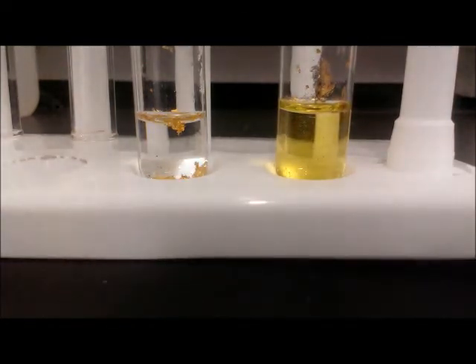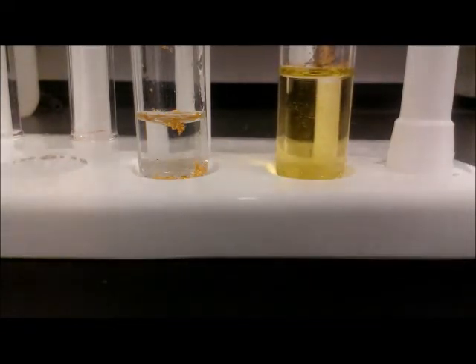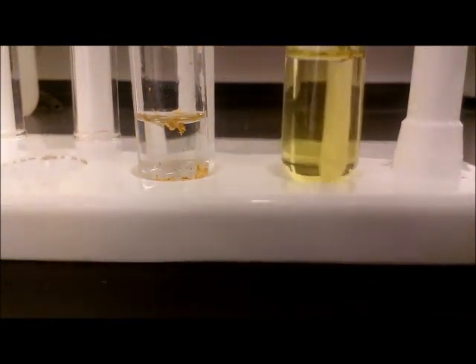You will see that after just a few seconds, the only gold remaining is that which stuck to the side of the test tube. This would not have happened had I used a gold nugget, but I am a college student and don't have money to just dissolve gold nuggets.